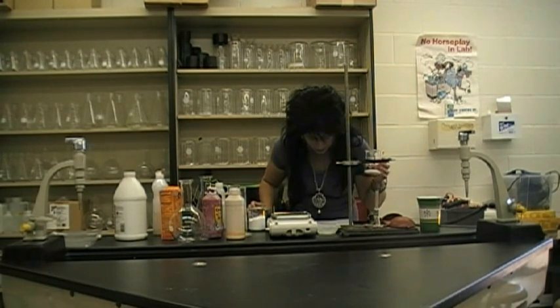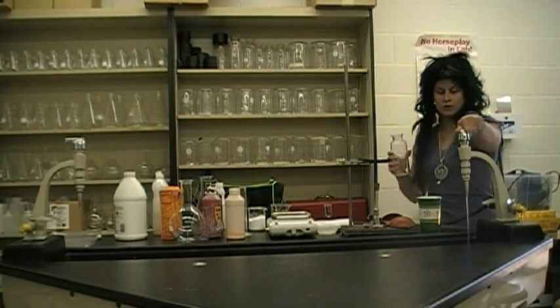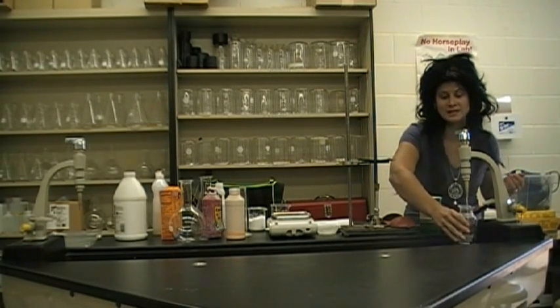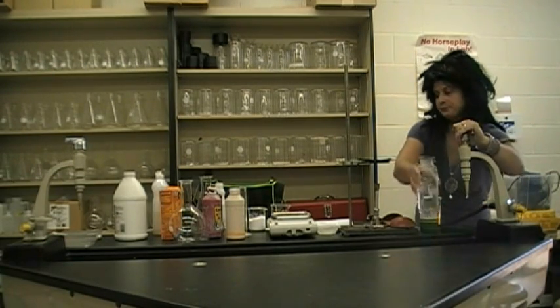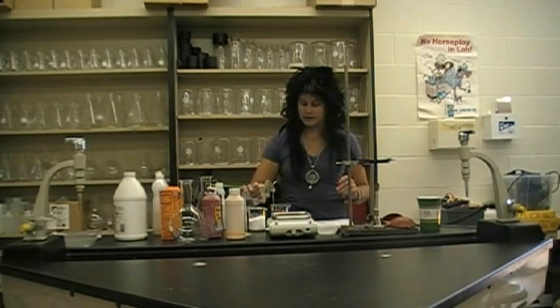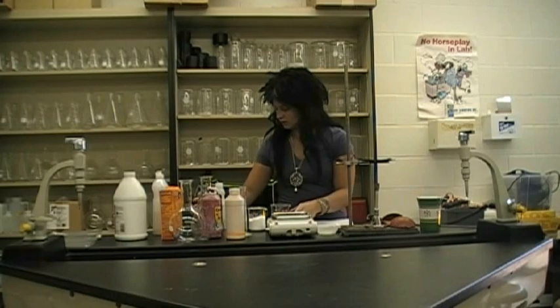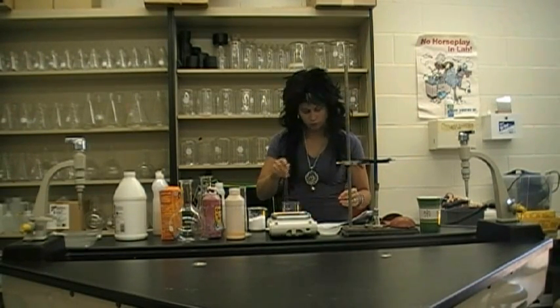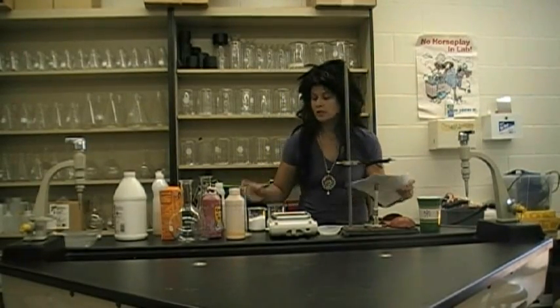Next, I need some water. Let's put water in here. Wow, this really has a lot of water pressure! I almost lost the container. I think this is a stirring stick here. Let's put that away. Oh! Let's start again.